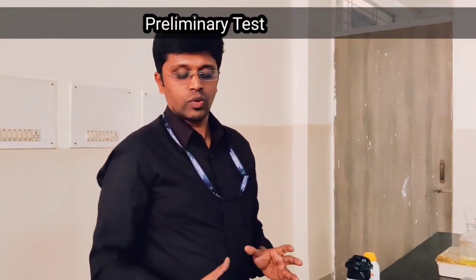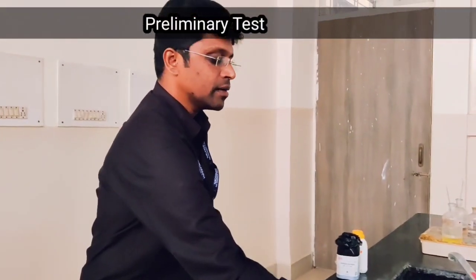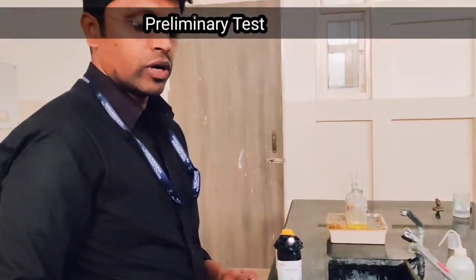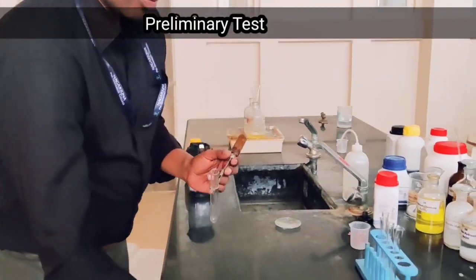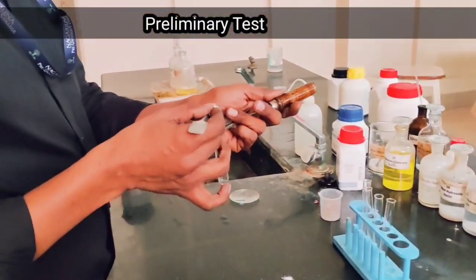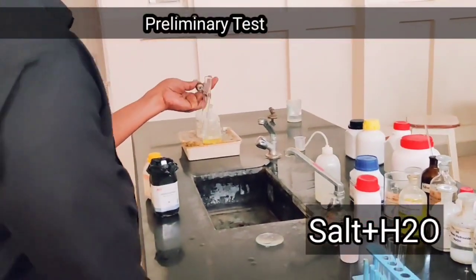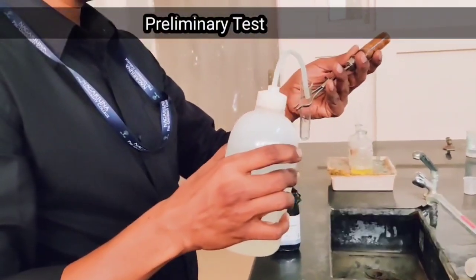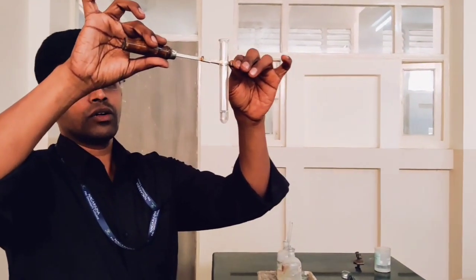The last test we can predict is solubility. Let's check its solubility. We will take a pinch of the salt and add water to check the solubility. The salt is more soluble in cold water.